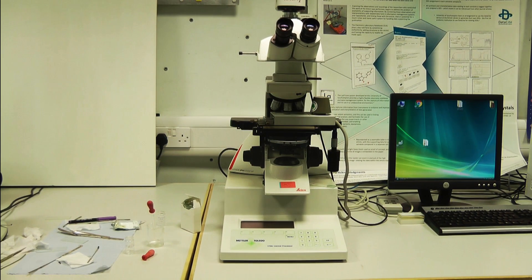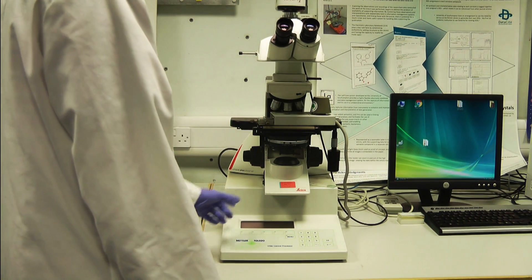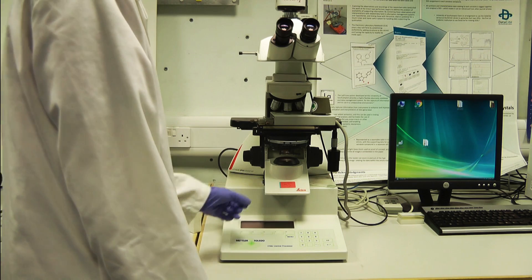To use the hot stage microscope, first ensure the computer, hot stage and microscope are all turned on.